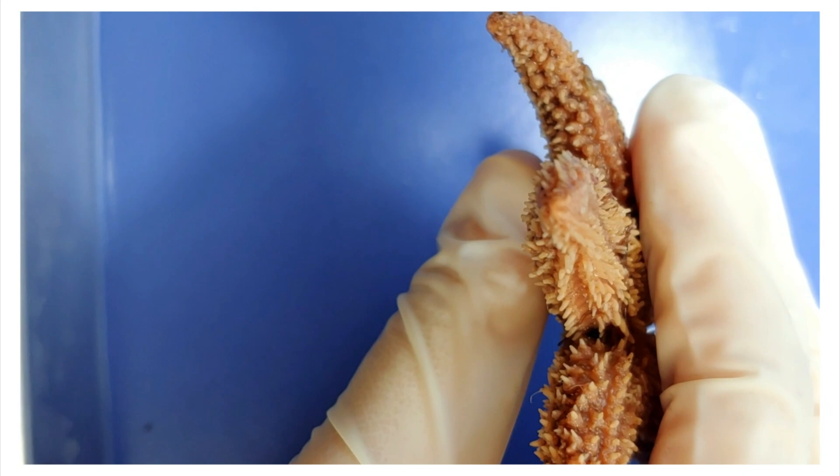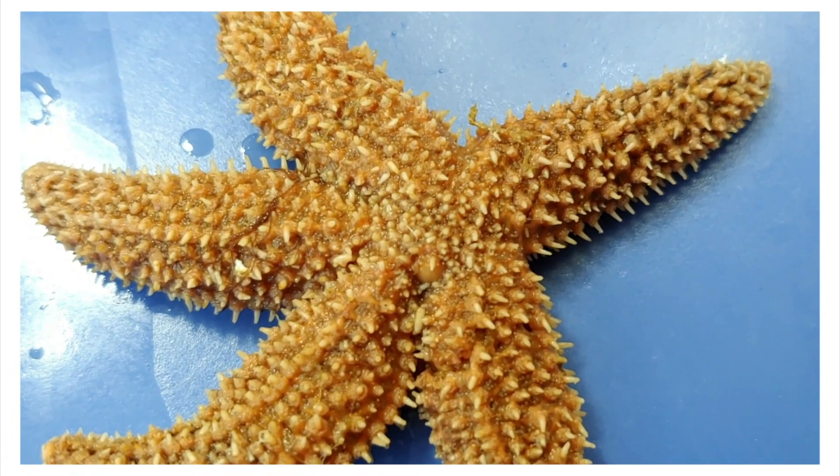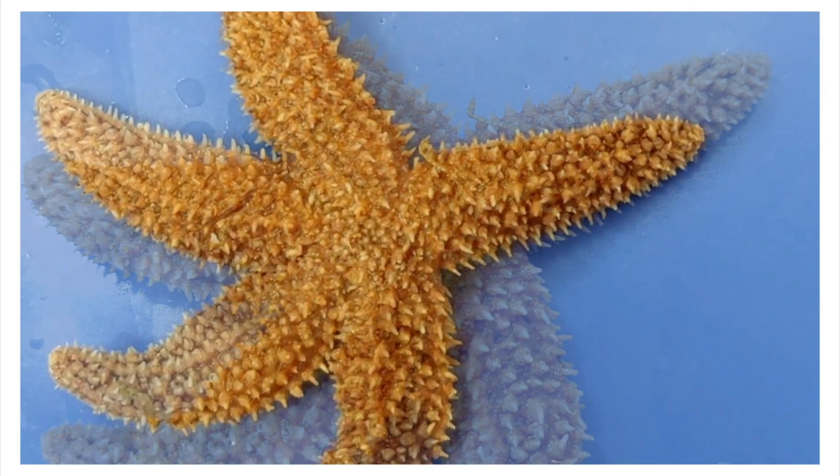Imagine if your eyes were at your fingertips — that's what a starfish has to deal with every day. Here you can see this small white bump, which is called the madreporite. I'll keep you in suspense for what it does until later. You can also see that the skin is covered in spines for protection.